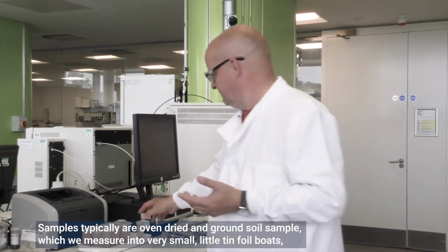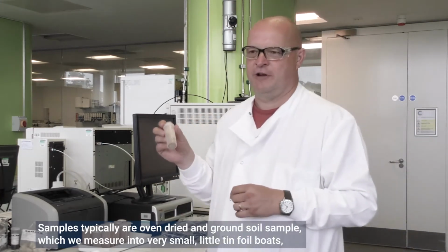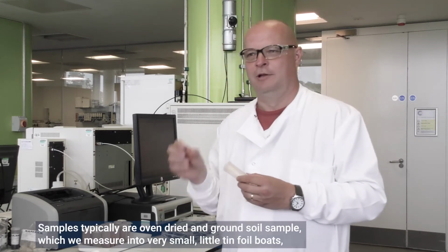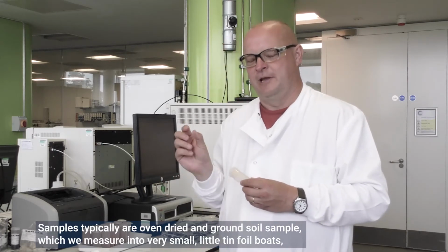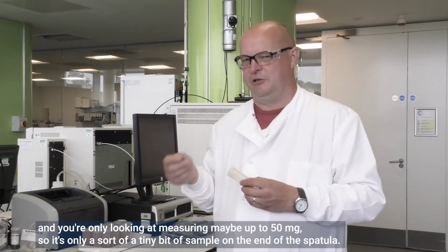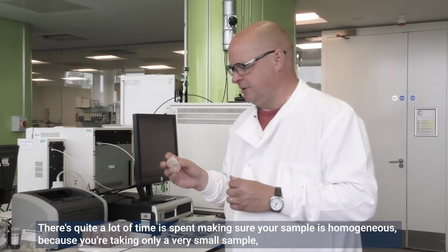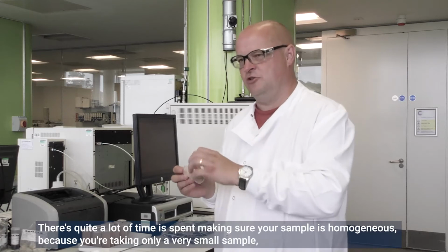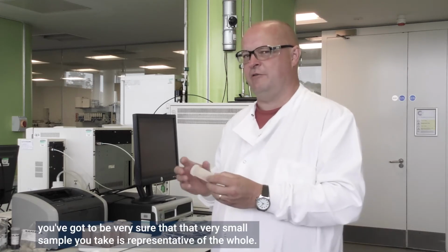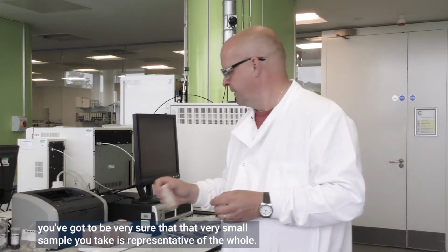Samples are typically an oven-dried and ground soil sample, which we measure into very small tin foil boats. You're only measuring maybe up to 50 milligrams, so it's only a tiny bit of sample on the end of a spatula. Quite a lot of time is spent making sure your sample is homogeneous. Because you're taking only a very small sample, you've got to be very sure that the very small sample you take is representative of the whole.